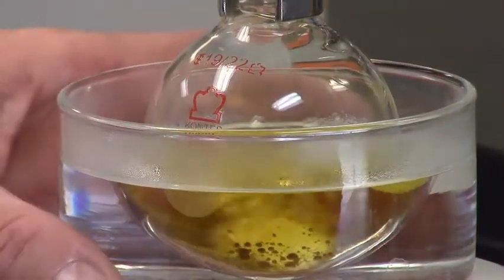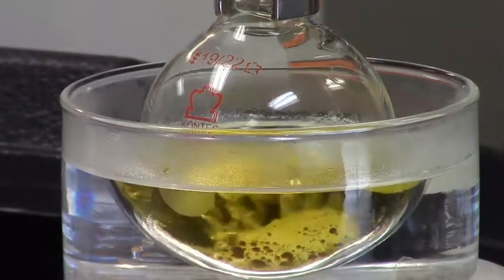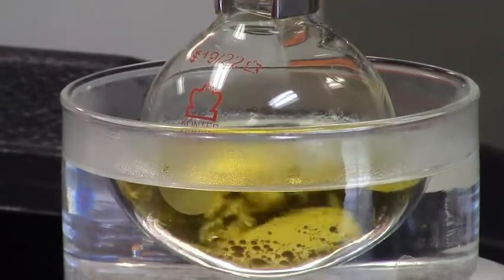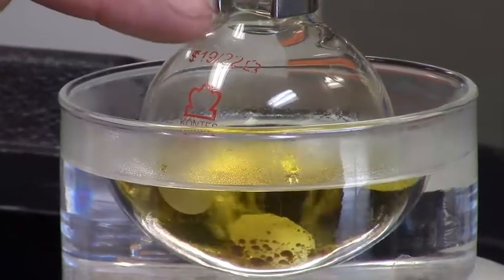It's been less than two minutes, it's just a titch over a minute, it's heated sufficiently that it is actively boiling. I'll stop the stir, you can see it bubbling actively, as well as the condensation is occurring here.